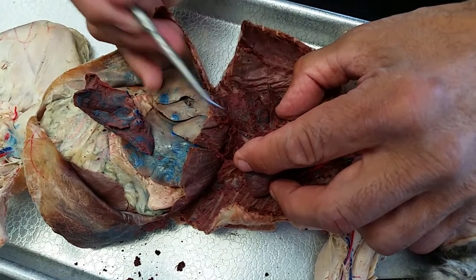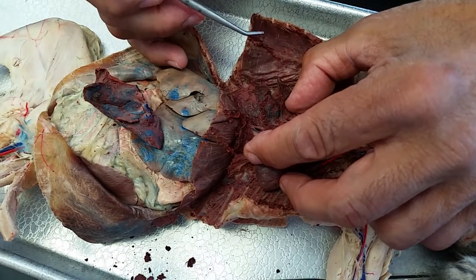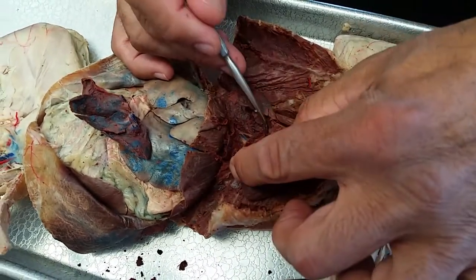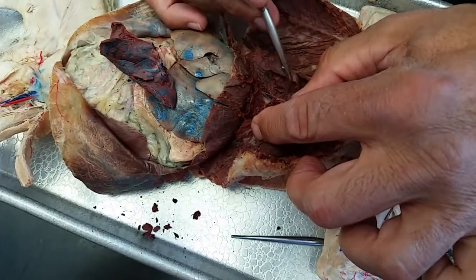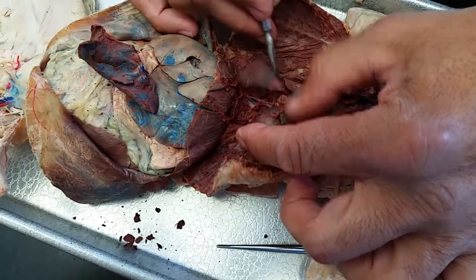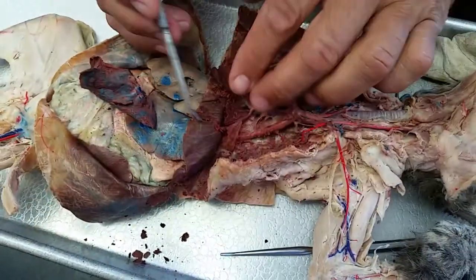This cat I wouldn't use — this is good for you guys to look at here. But the other cat in the front that's been dissected is the better one. Right here's your phrenic — it's going to be anterior, and it is. This is the pericardium right here. It's got so much necrosis in this tissue. See all the phrenic right there? See the white? That's all the phrenic nerve. It's anterior to the hilar lung, where your vagus is going to go posterior, because the vagus is going to go deep and follow the esophagus.